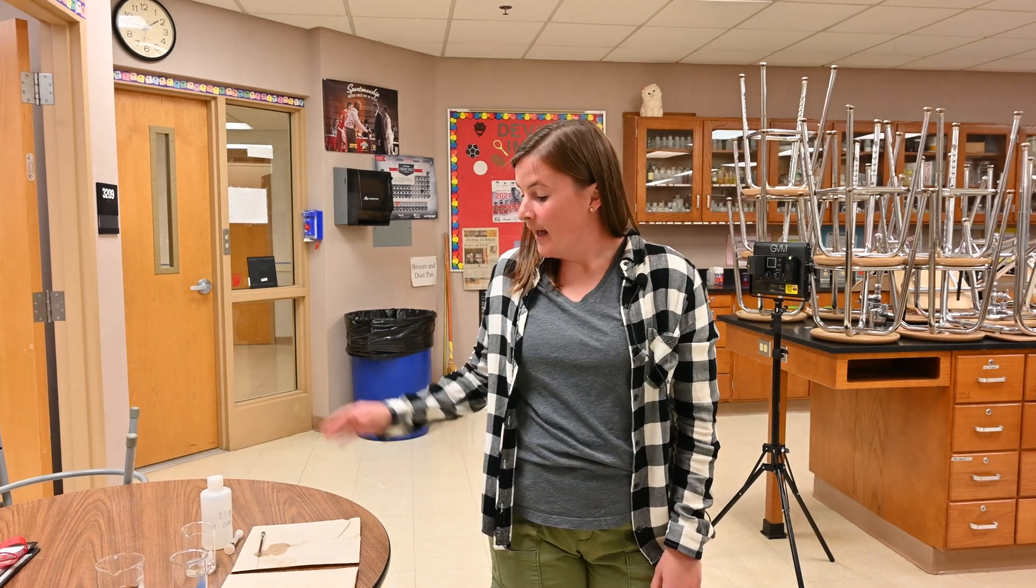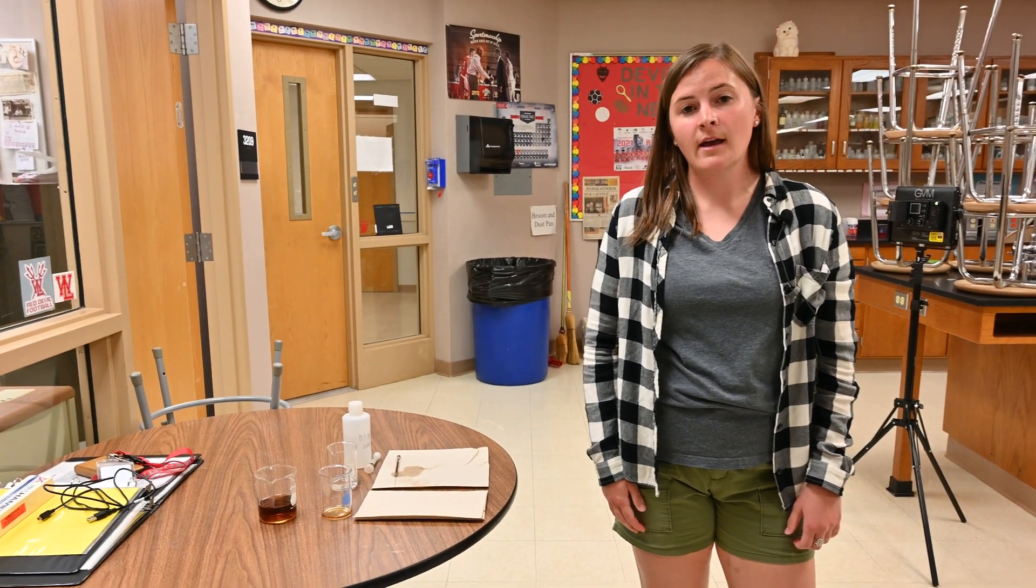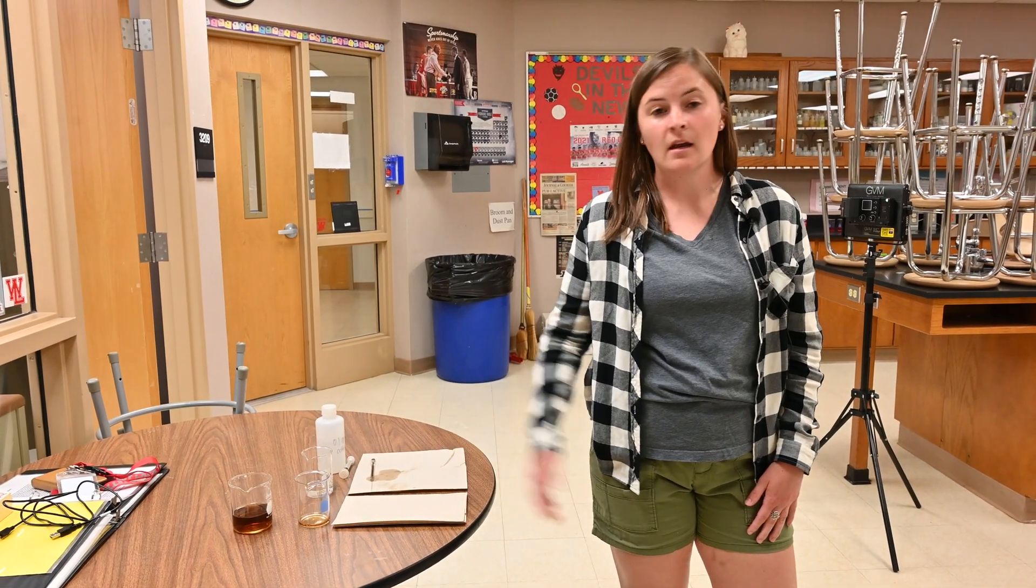Hi guys, today we are going to do our HPLC lab to analyze some caffeine. I have some pure caffeine that we're going to run through first and then we're going to try out some diet Pepsi and see where caffeine peak lies within that drink.